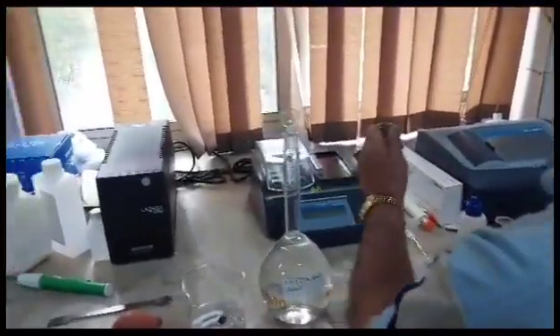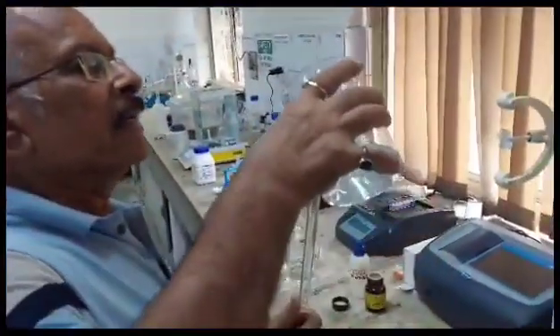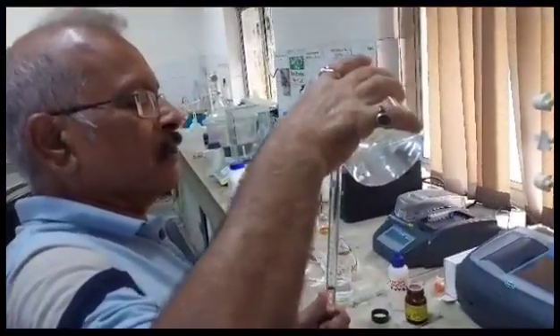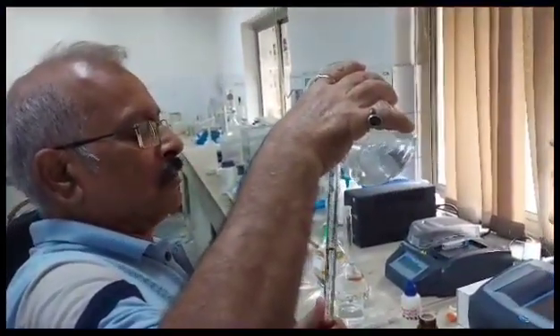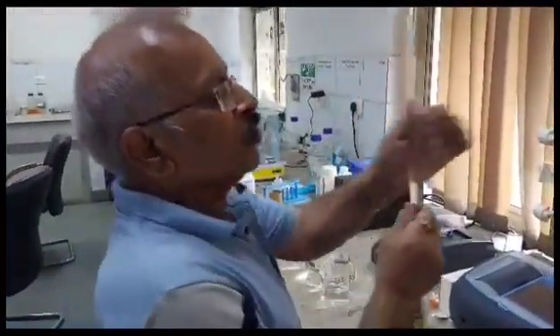Now we are filling the EDTA solution into the burette. We are filling the EDTA solution in the burette, taken from the flask — beginning to fill the burette with approximately 0.01 M EDTA solution up to the 0 mark.